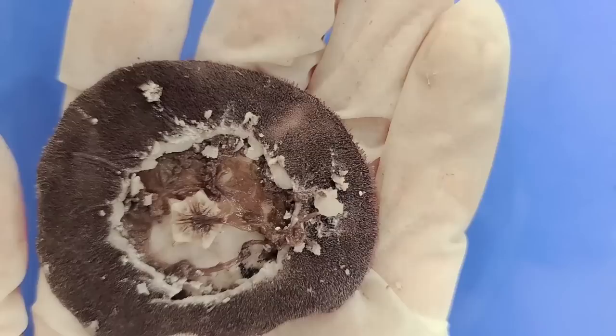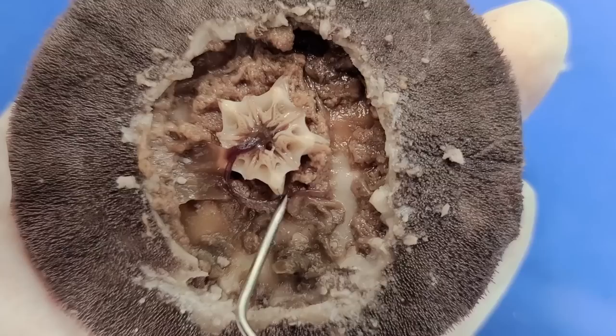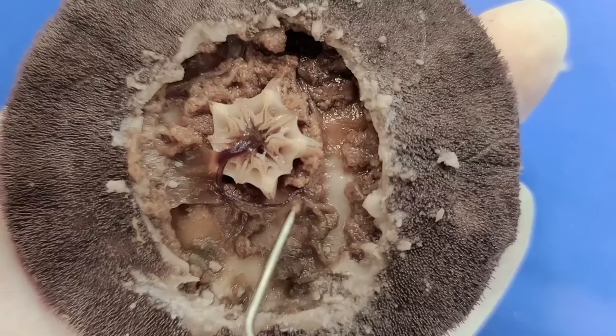The stomach also has this very thin additional yellow tube that runs alongside it. This tube is called the siphon, and it's involved in the reabsorption of water or nutrients from food.